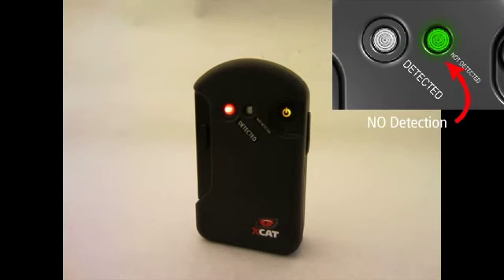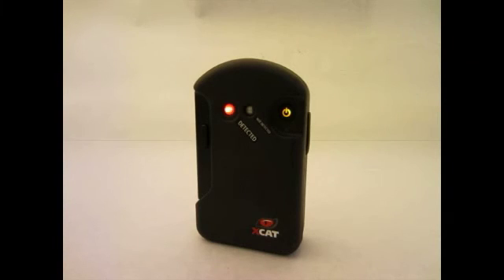Processing time will vary depending on positive or negative result, but all results should be received within two minutes. In this demonstration, a red light was received indicating a positive detection of amphetamines.